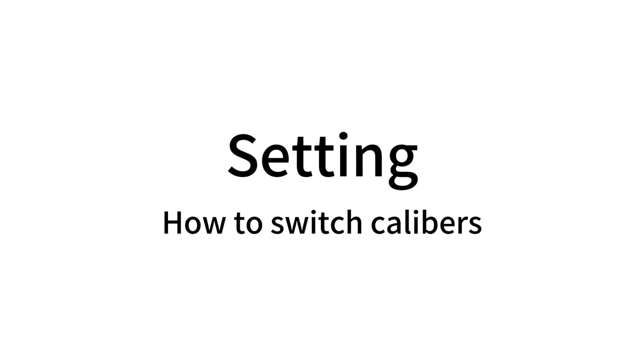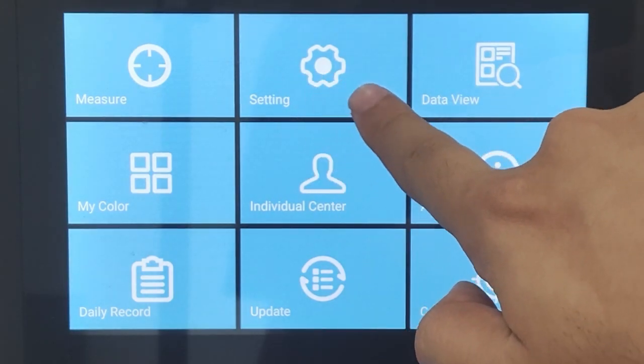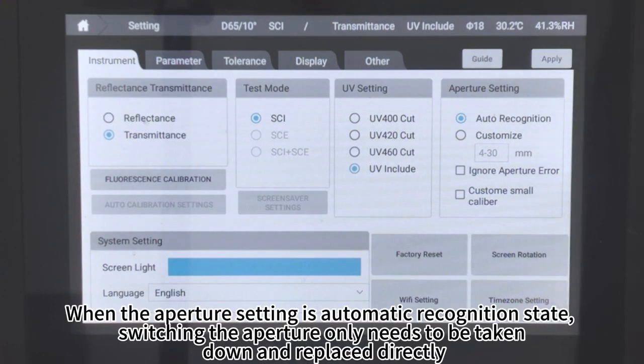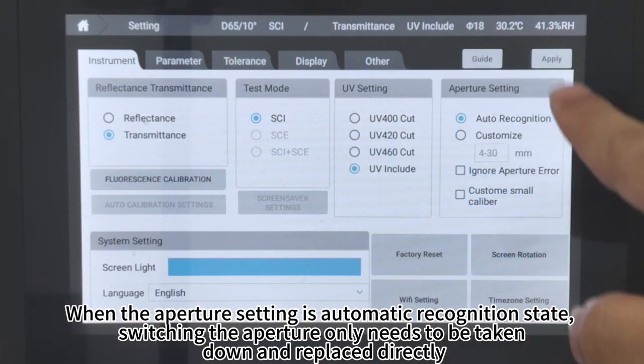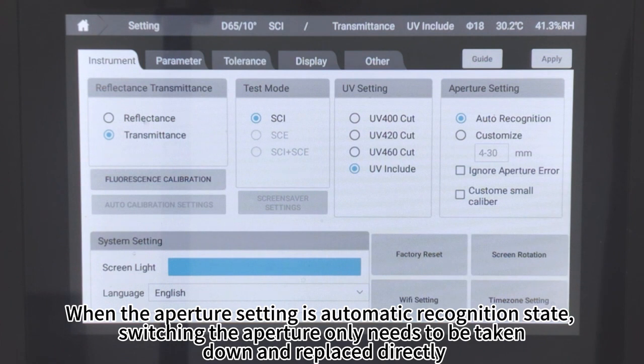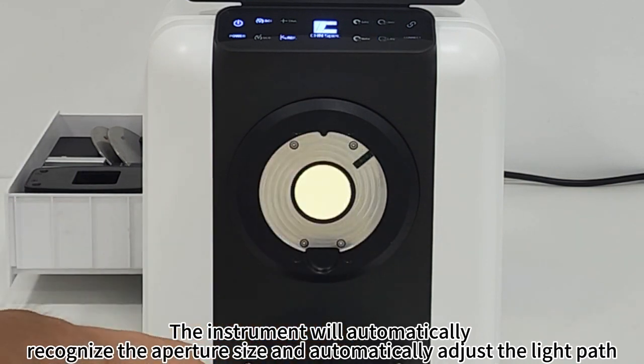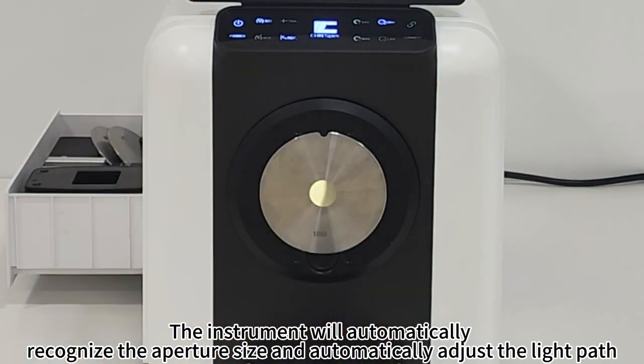Setting. How to switch calibers. Click Setting. When the aperture setting is in automatic recognition state, switching the aperture only needs the old one to be taken down and the new one replaced directly. The instrument will automatically recognize the aperture size and automatically adjust the light path.